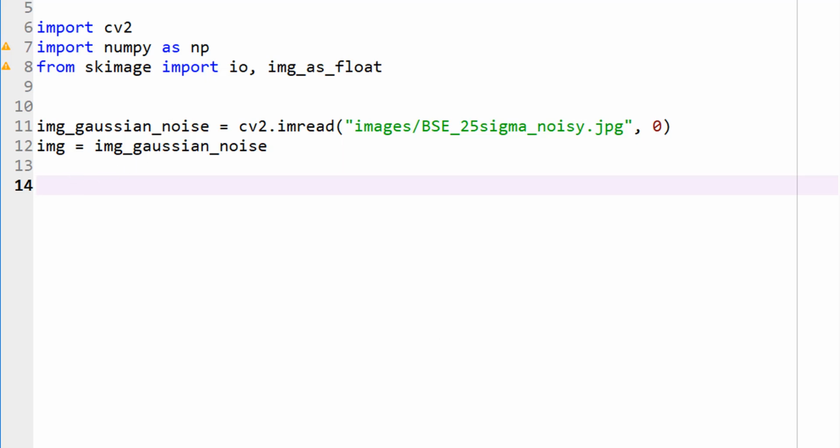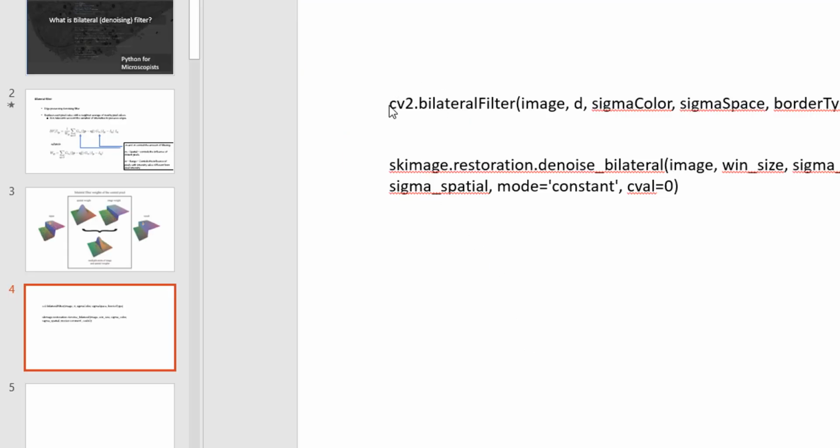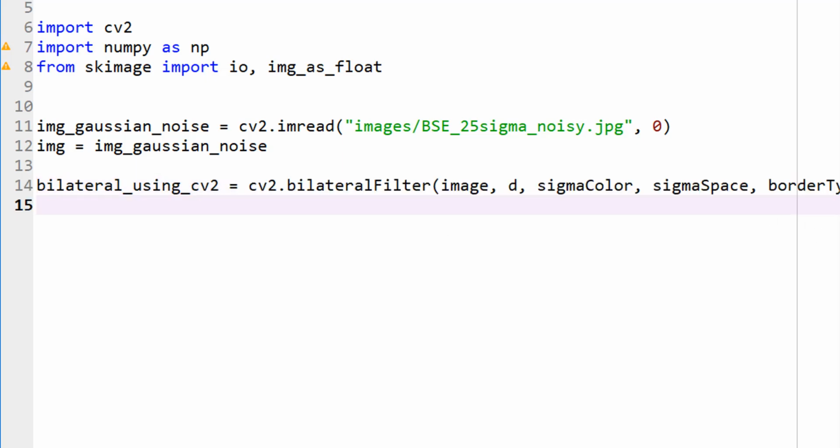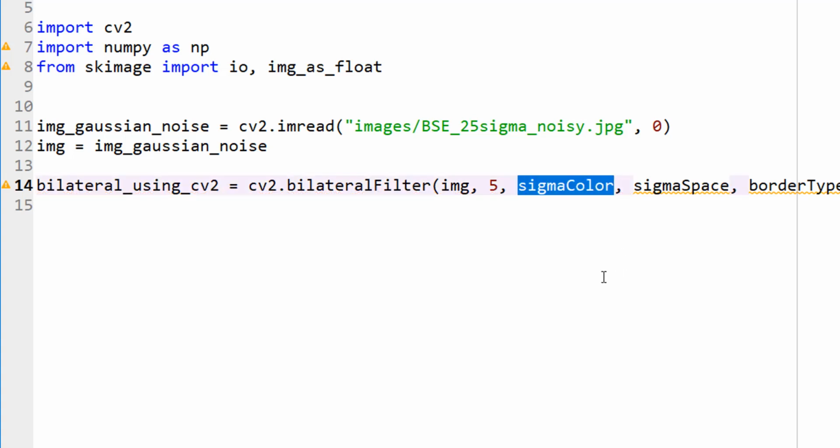Again, going back to this presentation, so cv2.bilateral. In fact, let me go ahead and copy that and paste it here. So let's say bilateral using cv2 is, let me open this up, cv2.bilateralFilter. I called my image as img, right? This is what we labeled it there. And my D is going to be, let's just put it as 5 pixels, and sigma color is 20.